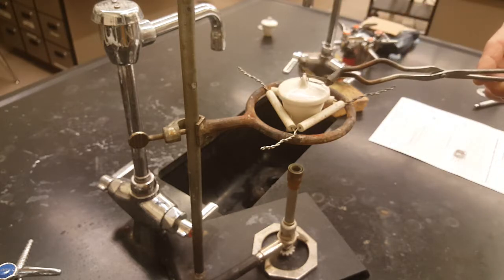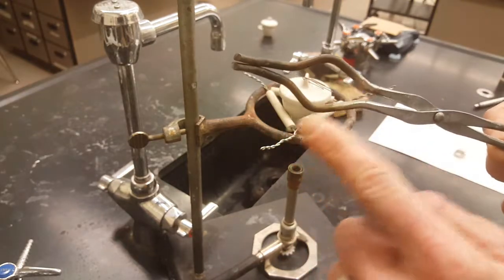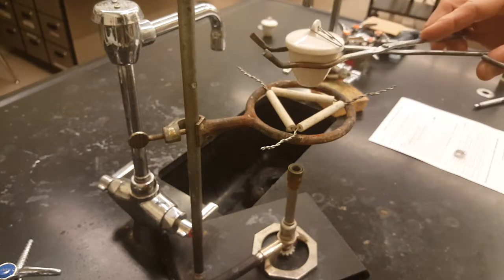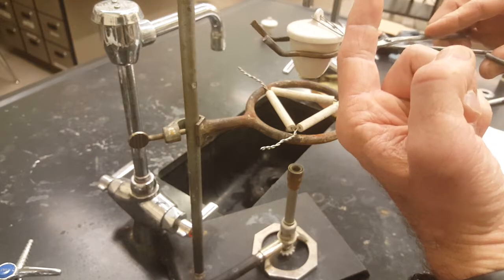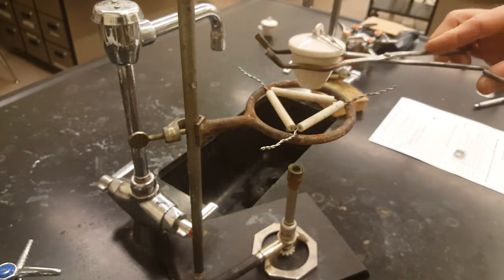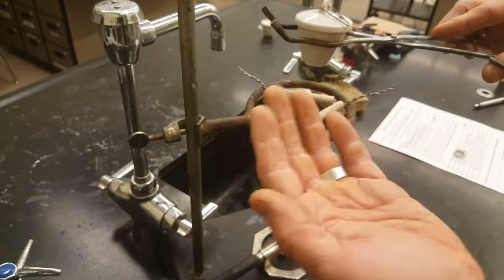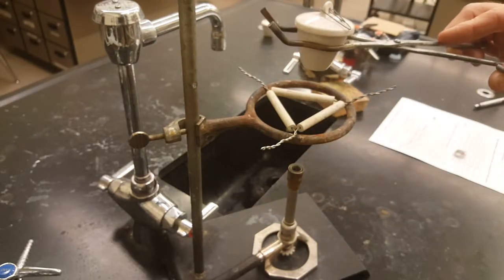Also, the reason that there's a diamond shape is so that you can pick up your crucible. If you squeeze too hard, the crucible is going to pop up out of there, fall to the ground, and shatter. And you'll have to start your experiment over. So you might want to practice this or come and get some heat resistant gloves and wear those underneath this so you can catch it if it falls.